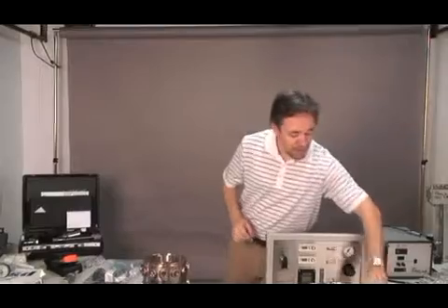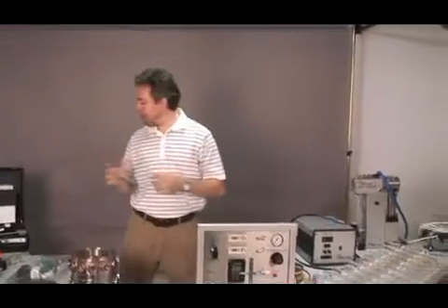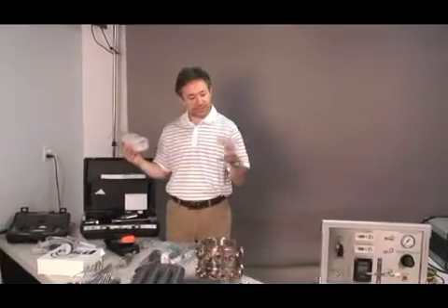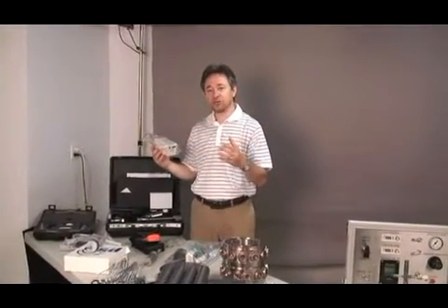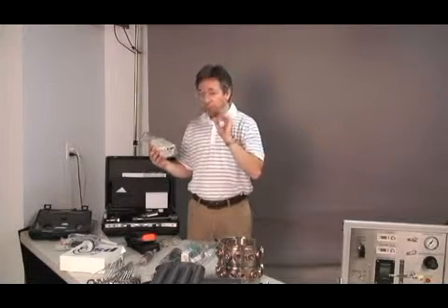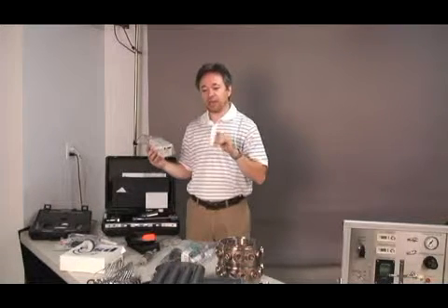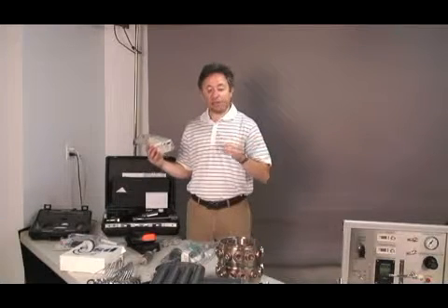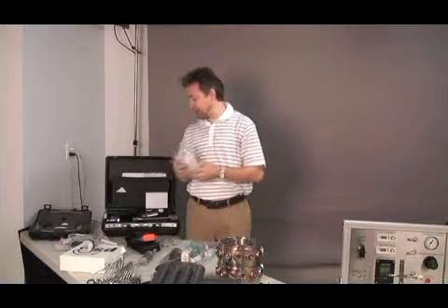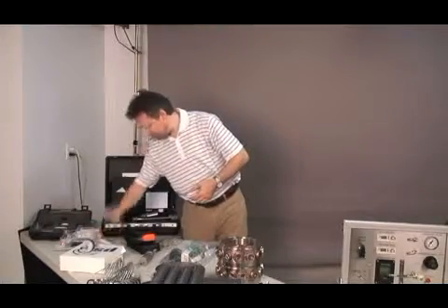The bioaerosol nebulizing generator is used in tandem with a small peristaltic pump. This system allows you to supply the generator with a known amount of liquid. So the feeding rate of liquid in the BANG is going to be appropriate to your standard operating procedures, and we will demonstrate later on how the BANG works with the peristaltic pump.